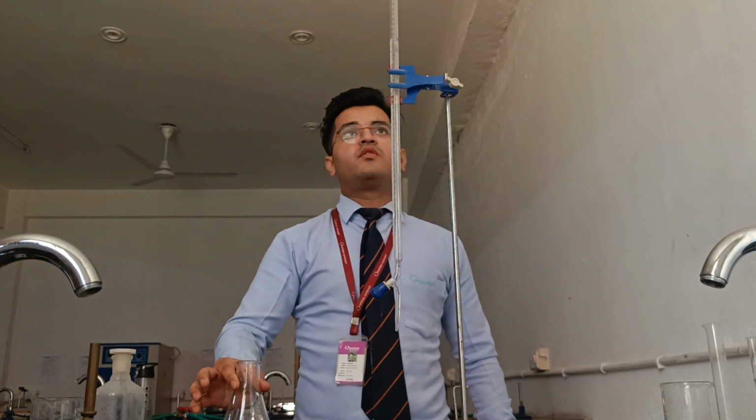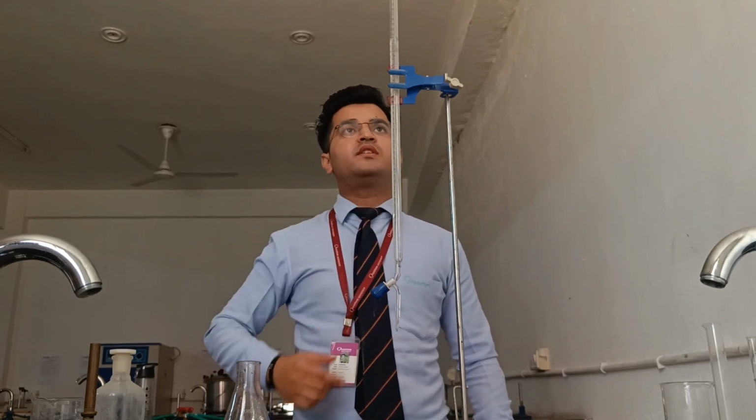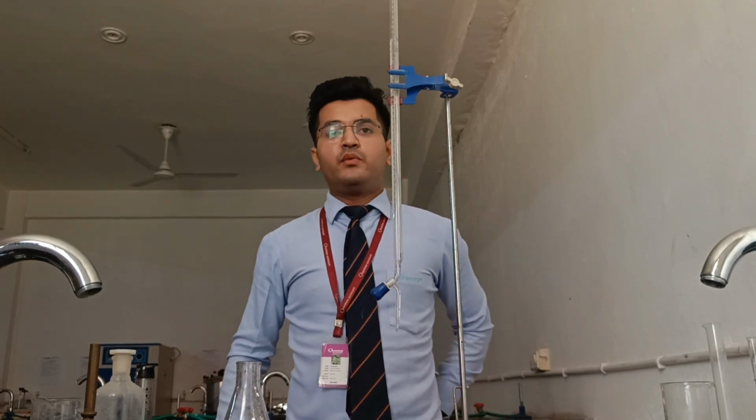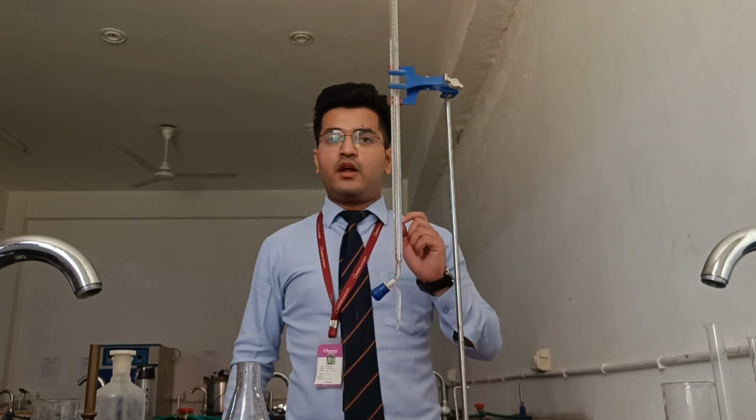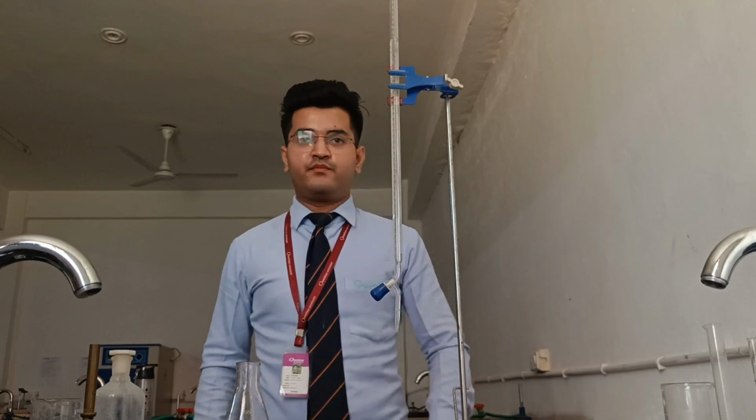So we will write down the reading. Here the reading is 12.5. Now we will take 3 readings for a precise and better result. And now let's move on to the calculation part.